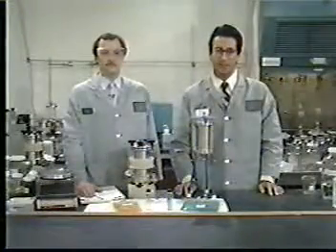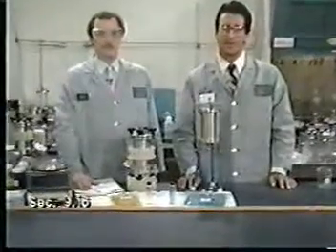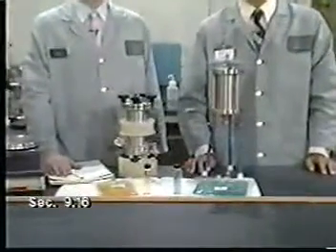After analysis, compare the contaminant concentrations to the thresholds listed in the appropriate regulations. This concludes the Zero Headspace Extractor TCLP protocol.